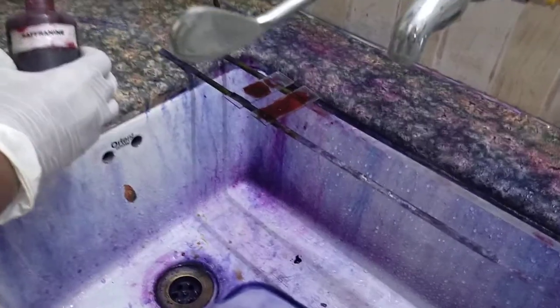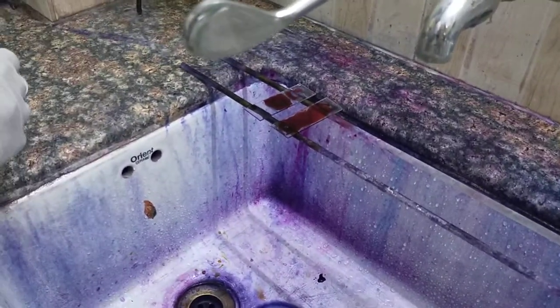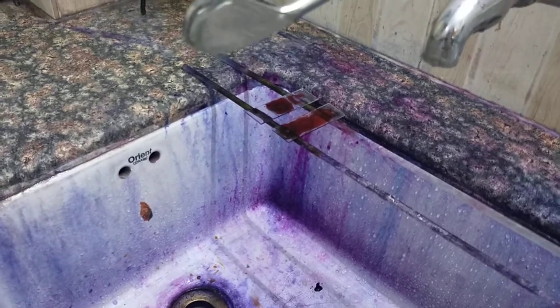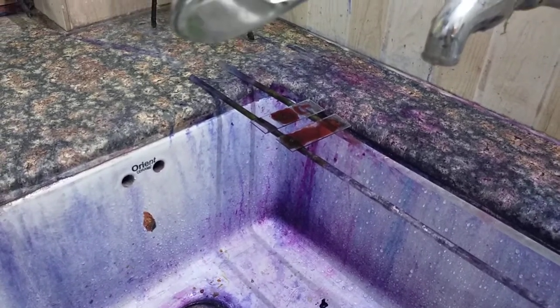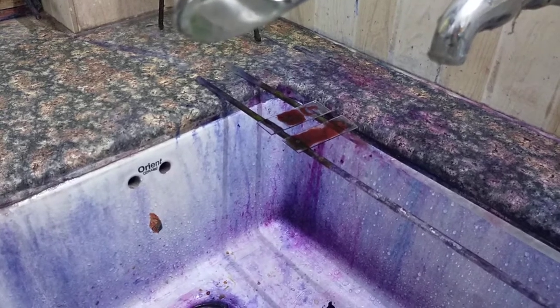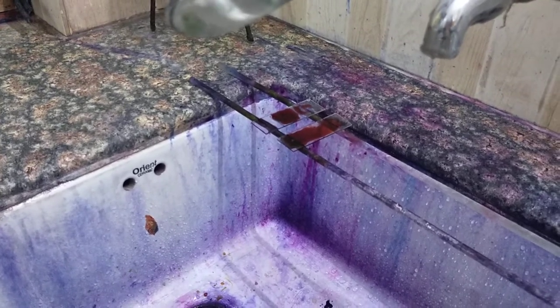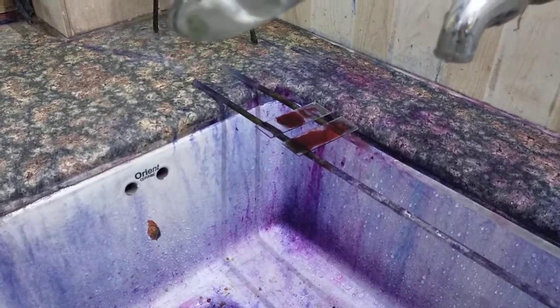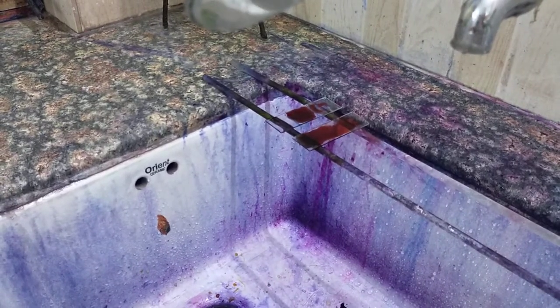We will put a counter stain — safranin — for 30 seconds. So gram positive bacteria take the primary dye and they appear violet in color, and gram negative bacteria take the counter stain safranin and they appear pink in color.